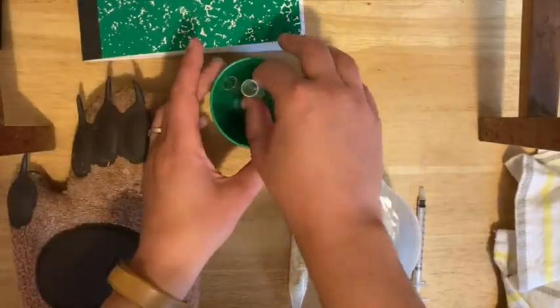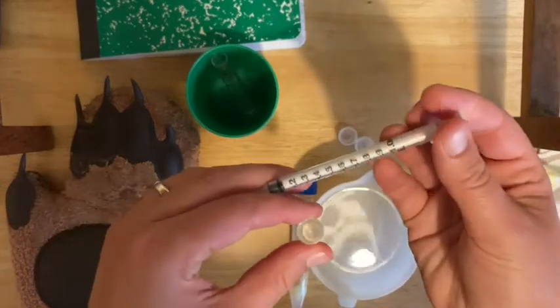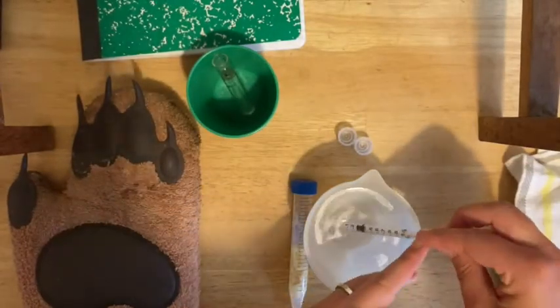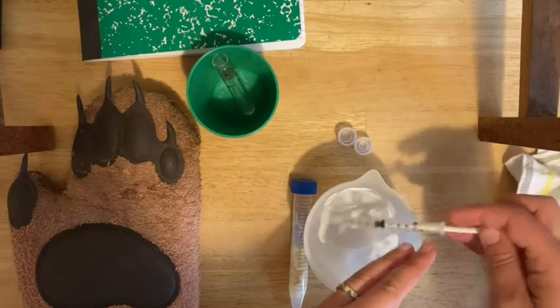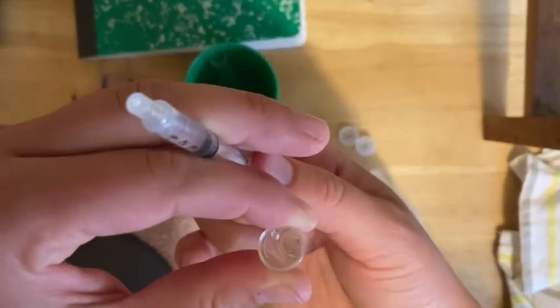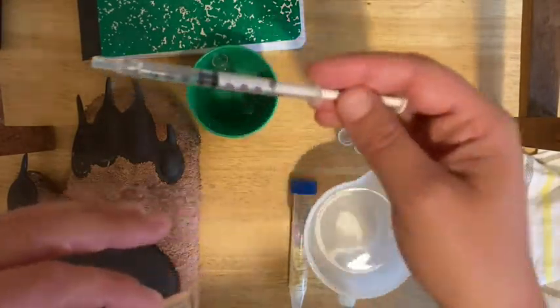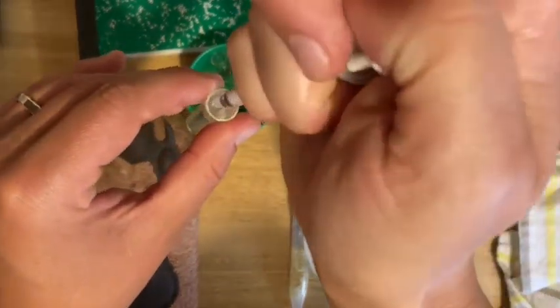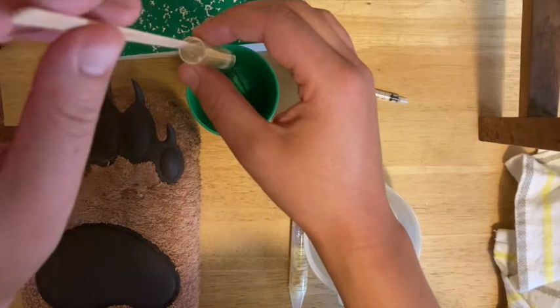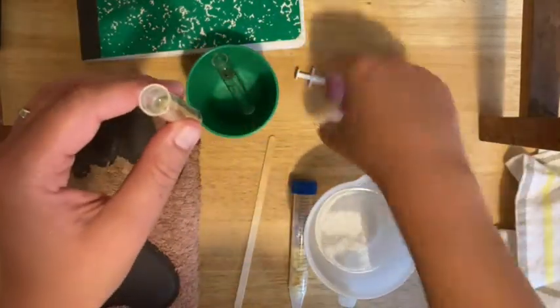Start with the minus C tube — that's your control. The control is just going to get water added, so you want to add 0.5 milliliters of plain water, measuring to the 0.5 line. It's important to start with the water, not with the pineapple, so you don't cross contaminate. If you've got any bubbles, flick it and push out the bubbles, then go back and add a little more so you have 0.5 mils. Squirt that in and stir with a wooden stir stick. Be gentle so you don't spill anything, then cap it and stand it upright.